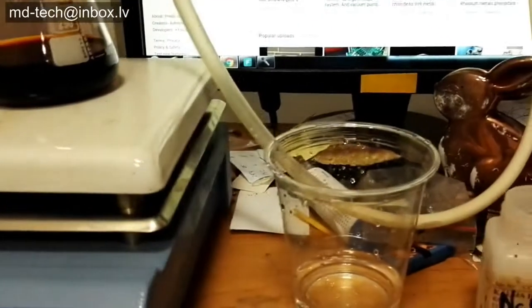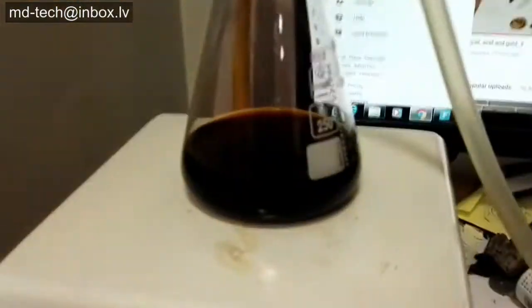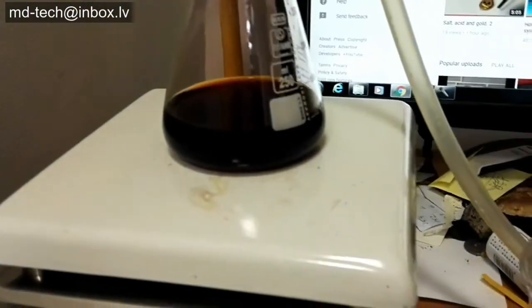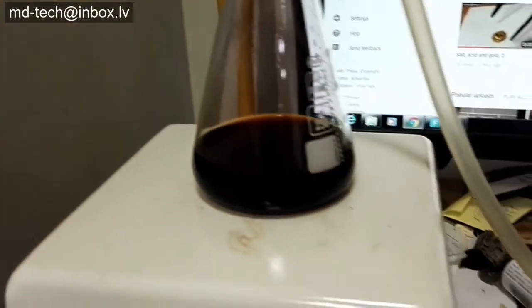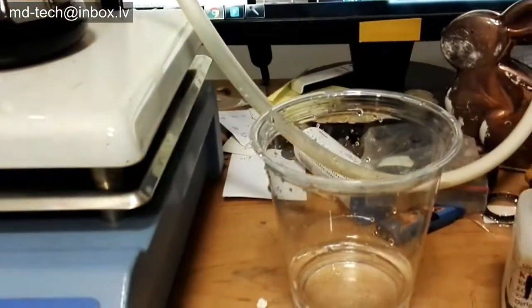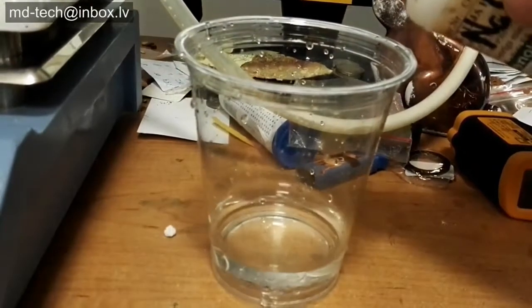Today I show how to recover gold from iodine solution. First you need to use a fume hood or vacuum gas washer. You need a very dramatic change in pH.